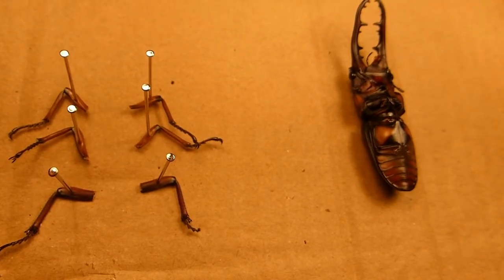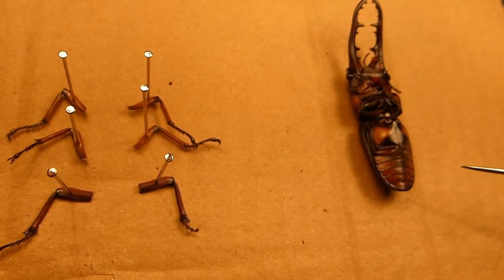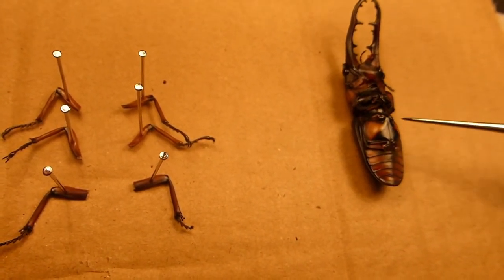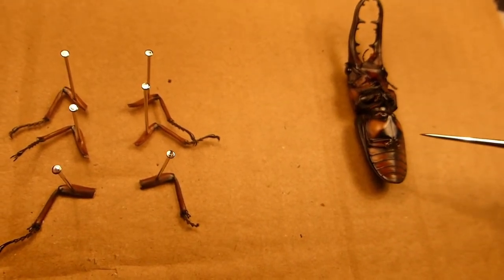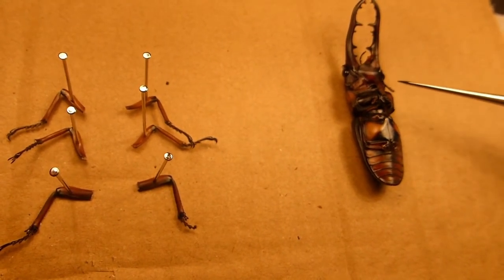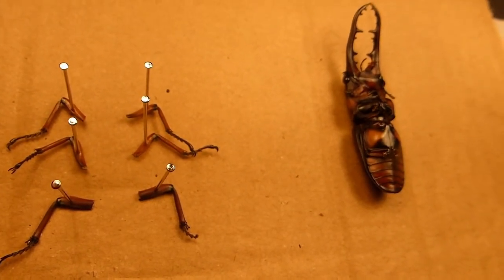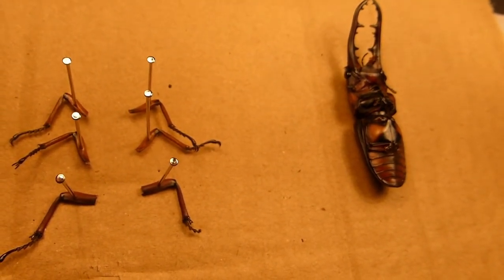I've now removed the legs from this beetle. You can see the underside — there's the segmentation of the abdomen at the back, and these are where the leg attachments were: the hind legs, the mid legs, and the fore legs. I'm now going to turn this over, pin the beetle body down, and try to have a look at the wings and the elytra.